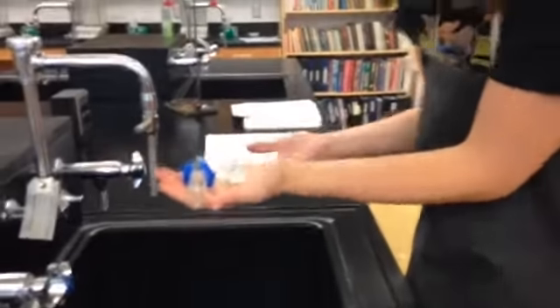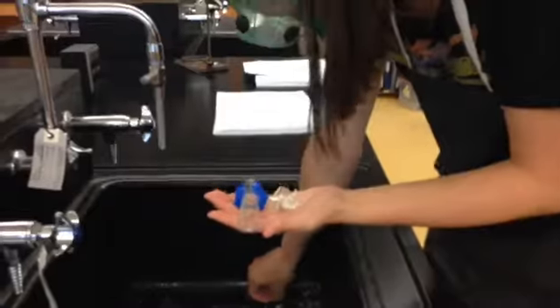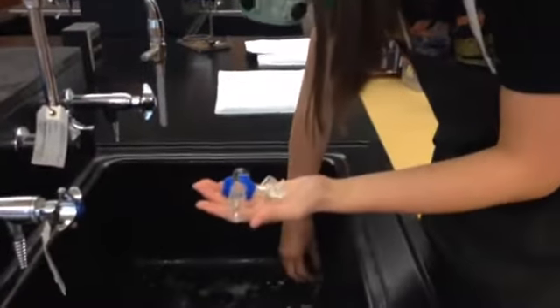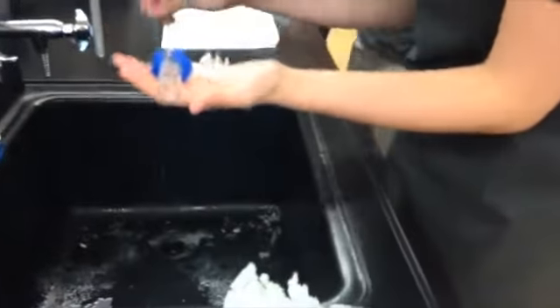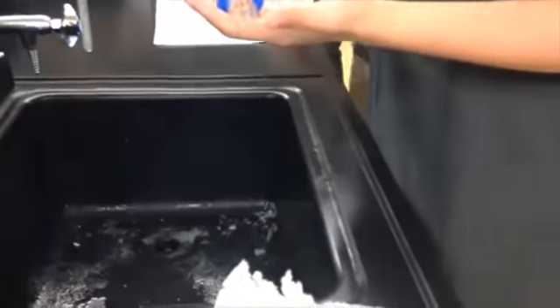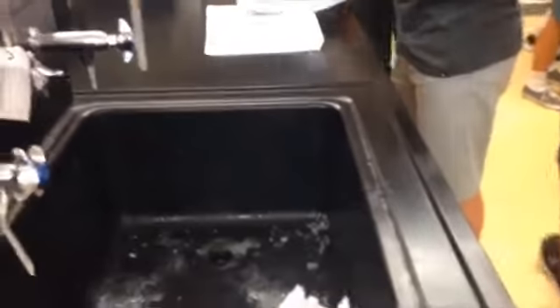If you somehow manage to screw up and break glassware, carefully gather up the pieces. You should really wear gloves while doing this. Also what I'm throwing back into the sink is salt, I am not washing glass down the drain. Anyway, then go put the shards in the designated glass disposal bin.